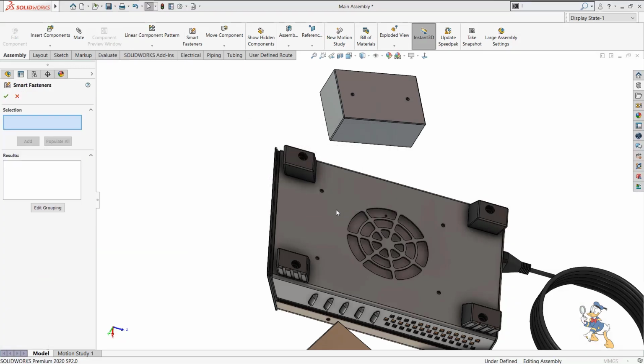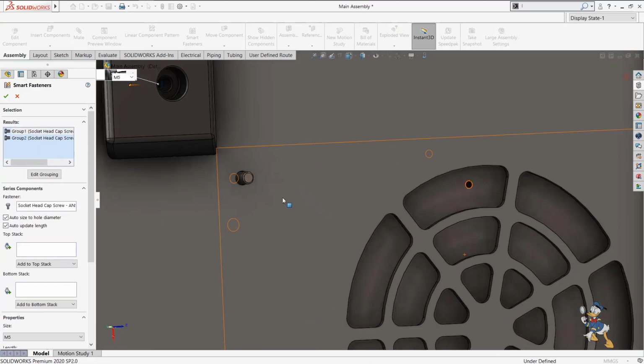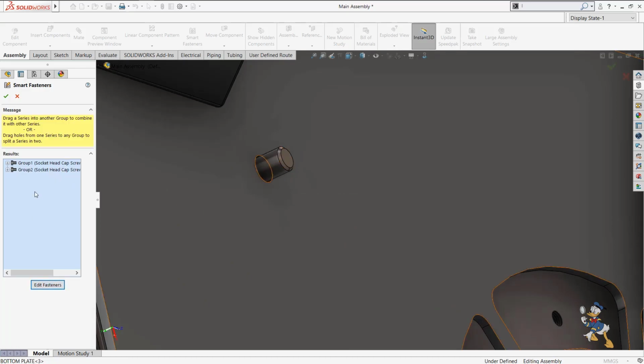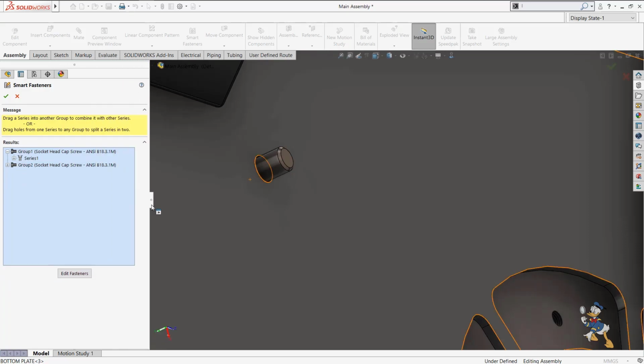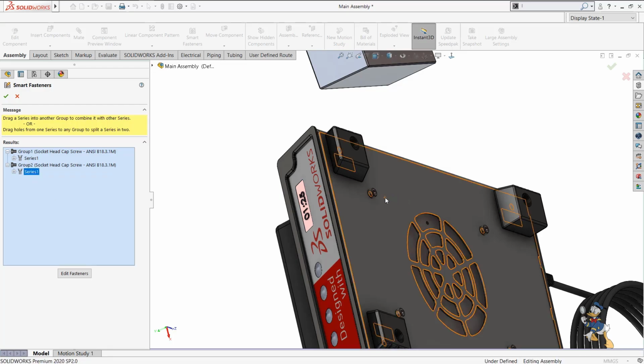It is showing a dialog box like this. I need to select the face over here. I need to add the smart fasteners feature, and as we can see, the smart fasteners are adding over here. But for now, suppose I just need to rotate this smart fastener. So we can rotate this smart fastener just by right clicking on it and flipping it over here. So we can flip the fastener feature in it.